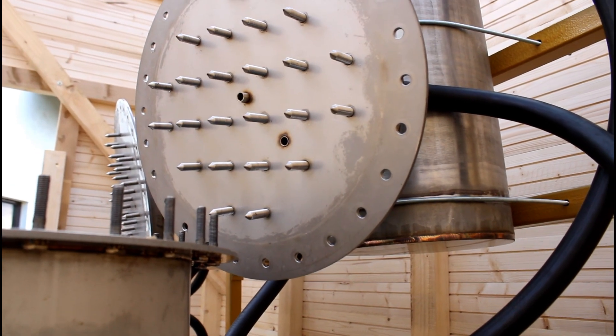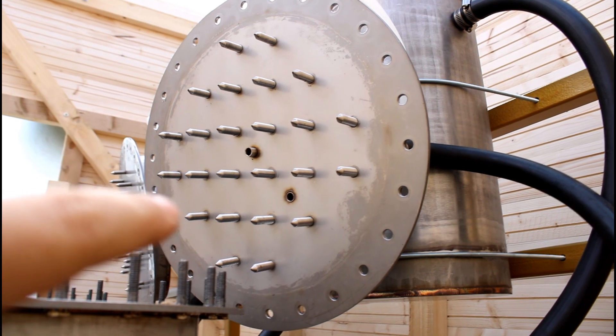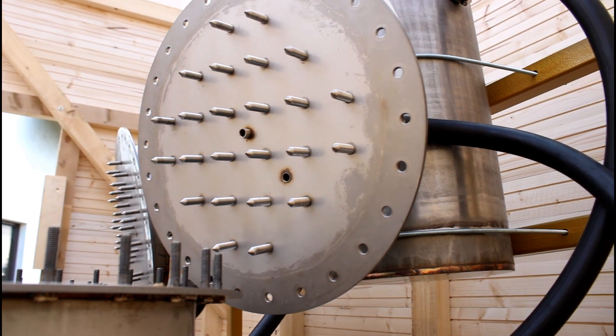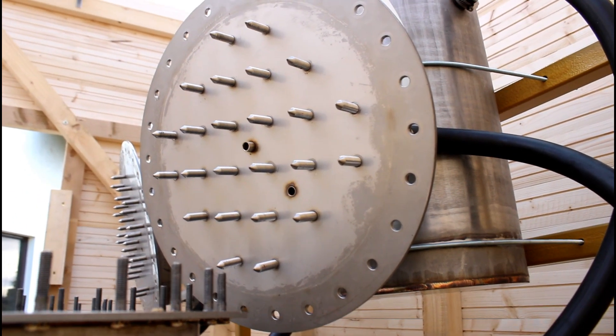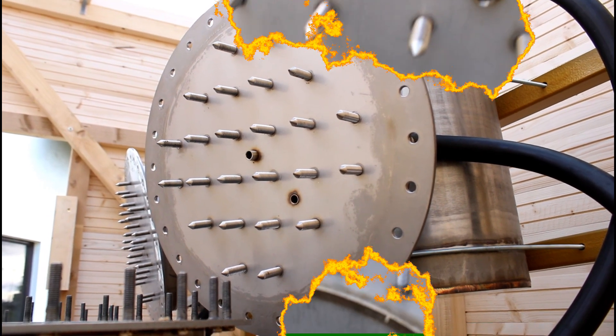That means that the side would not get extracted. But with this kind of setup it's possible to have an evenly distributed extraction of the herbal matter.